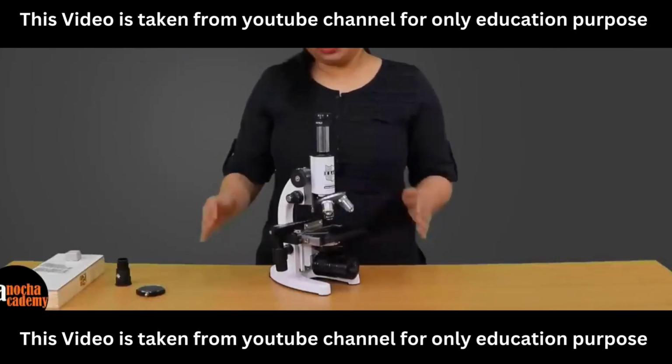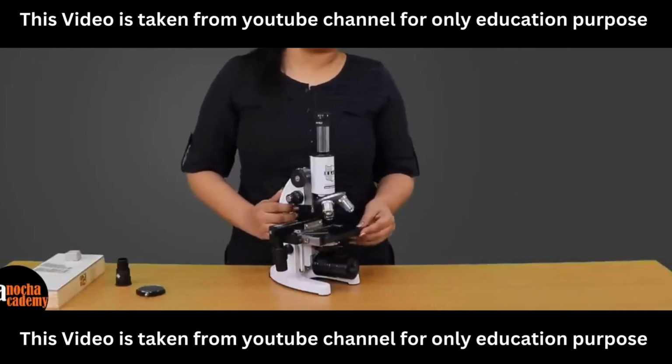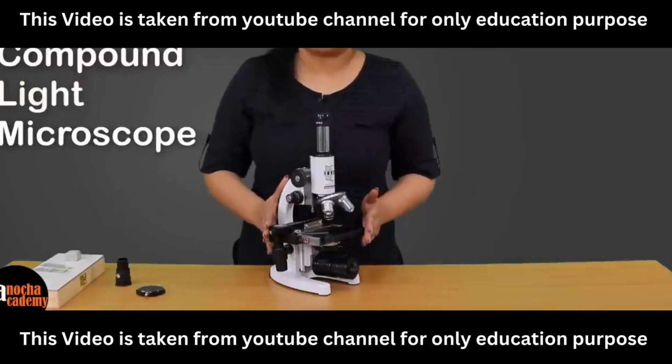In today's class, we are going to see the different parts of a compound microscope, and we are also going to talk about how the different parts work. Now this is a typical compound light microscope.